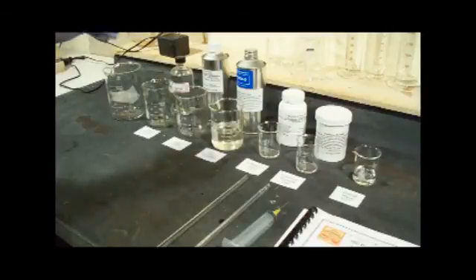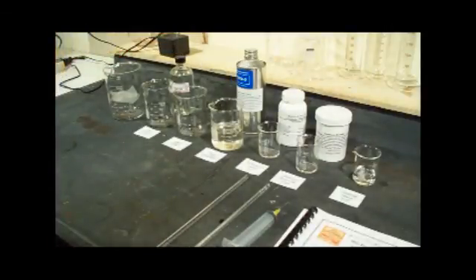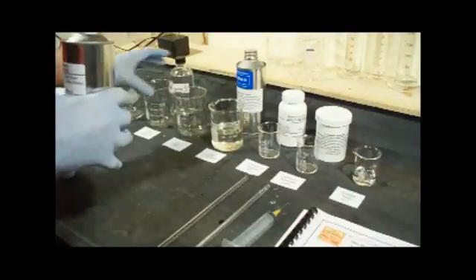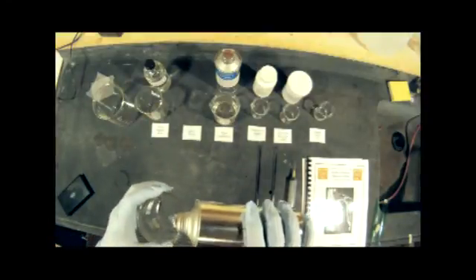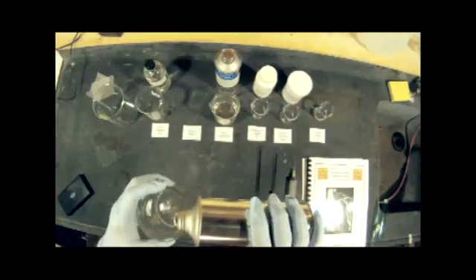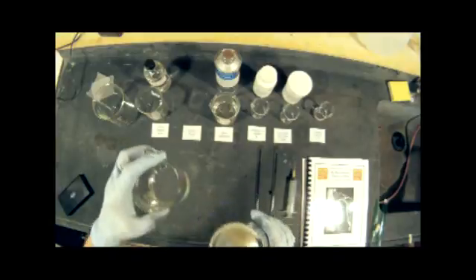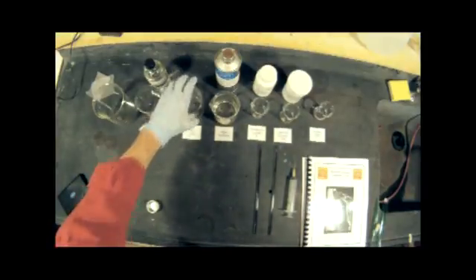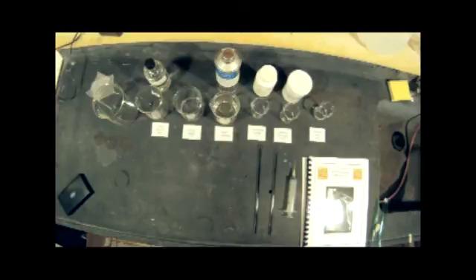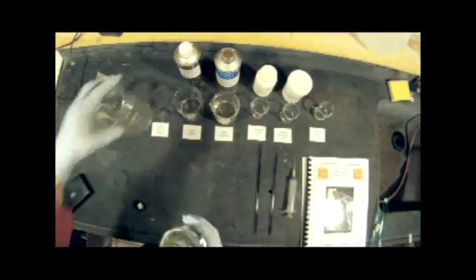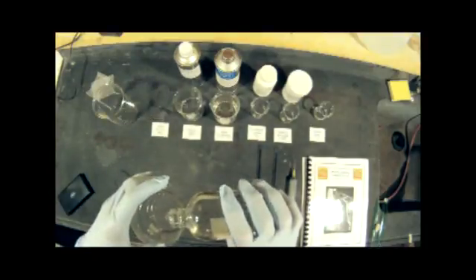Now let's measure that out. Ether also is very flammable. You don't want to use that around ignition sources. Also, you want to have plenty of ventilation. We're going to pour out 75 milliliters of ether. And then alcohol is the next component, and again, 75 milliliters is what we need.